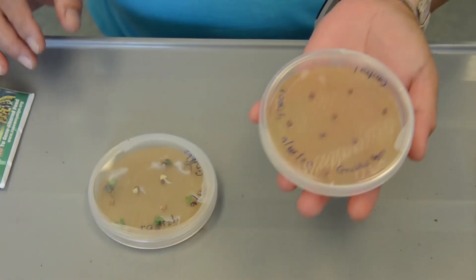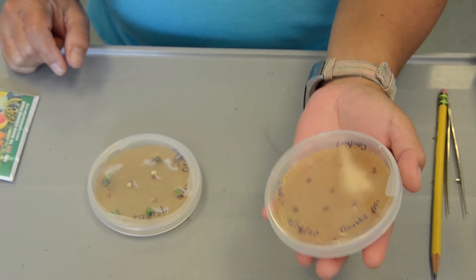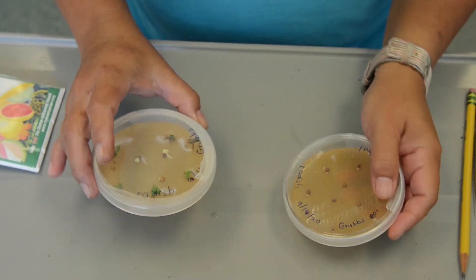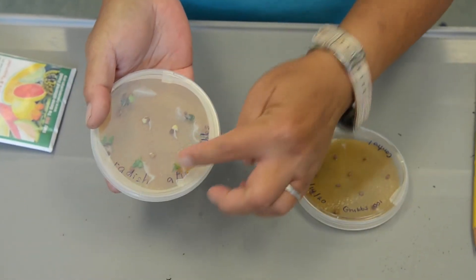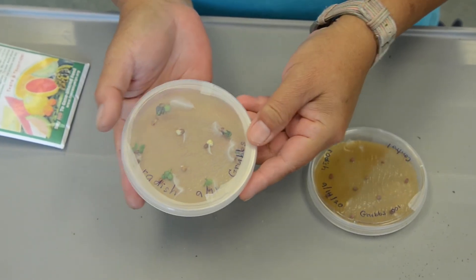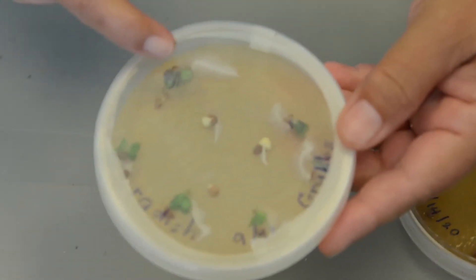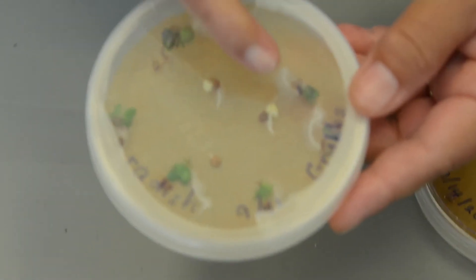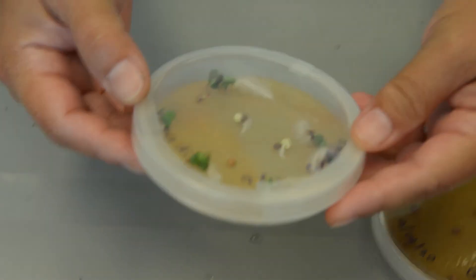So this is when we start the seed germination using radish. You can see the water kind of swirling inside. But this is what happens after three days. You can see the structure of the radicle that has that white fluffy looking root hair. You also see the cotyledons. Some of them are fully expanded. Some of them just start to germinate, which the color is slightly yellow. There's nothing wrong with that.